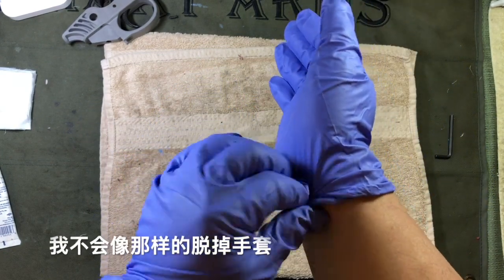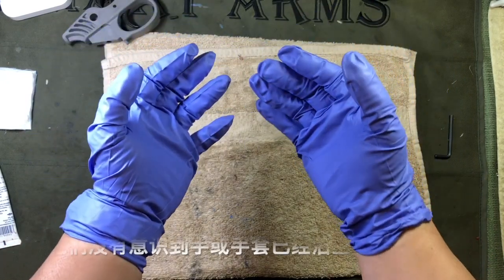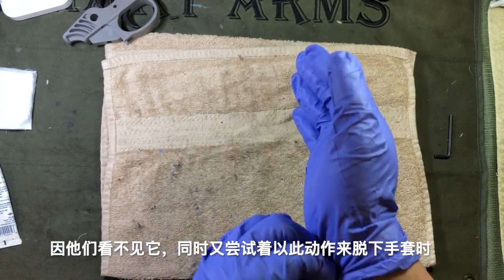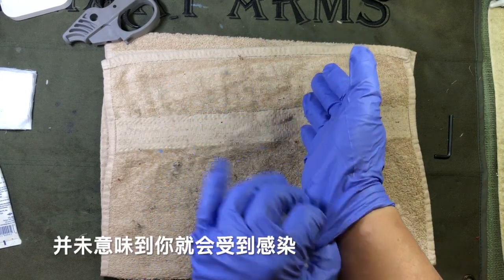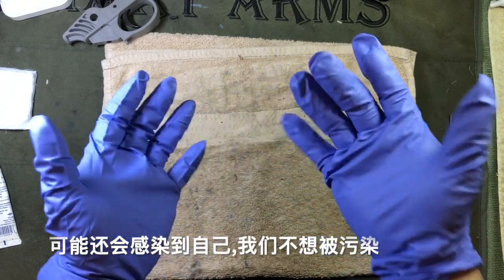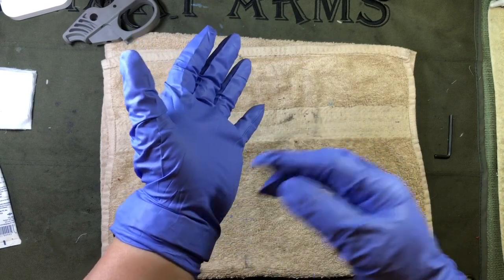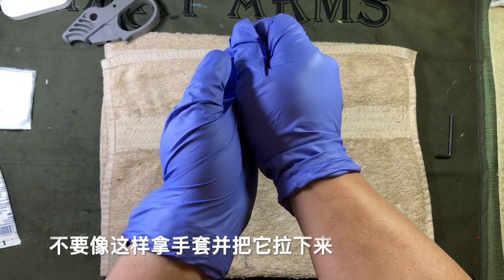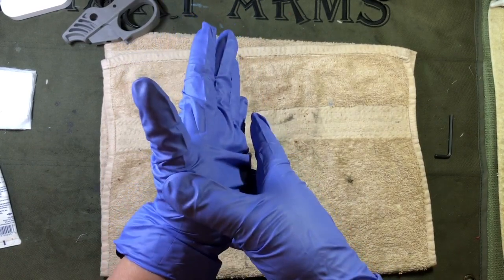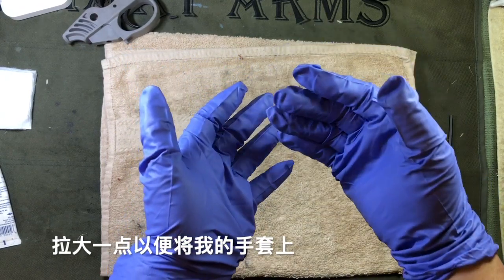I do not take off gloves like this. Imagine there's blood, pee, and poop — I think this is the issue with a lot of people who are contaminating themselves. They don't realize there is stuff all over the gloves, and just because they can't see it doesn't mean it doesn't transfer when they try to take off their gloves like that. At no point would you grab like this to get that stuff onto your skin. Notice how the glove is designed — the cuff opening is actually smaller than the width of the hand itself, so these gloves are designed not to just pull off like this.